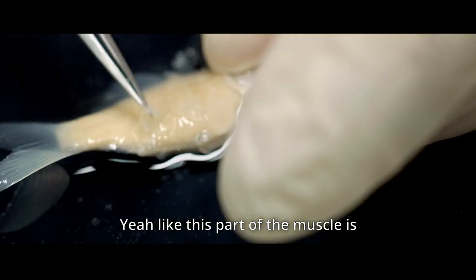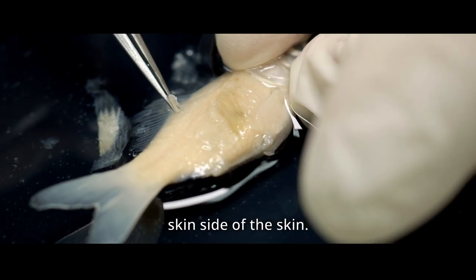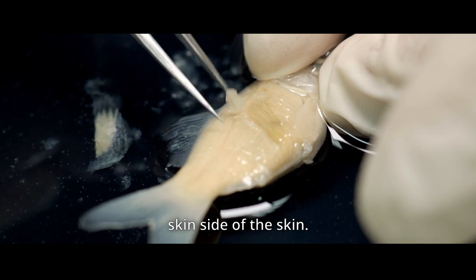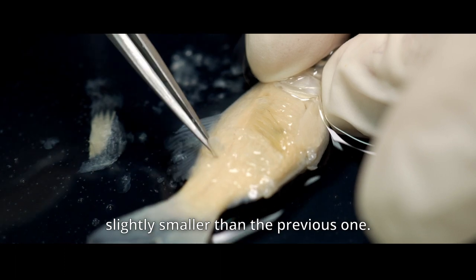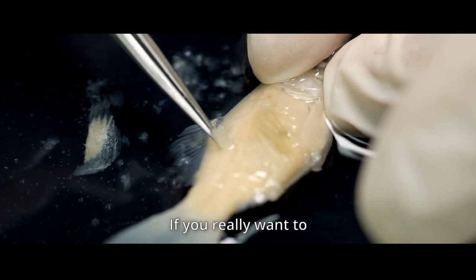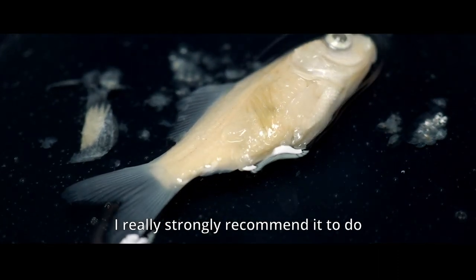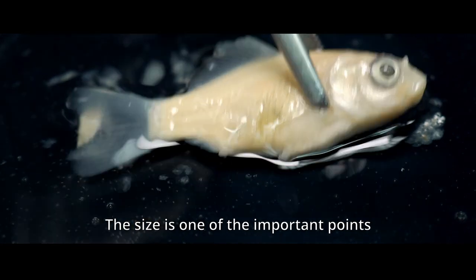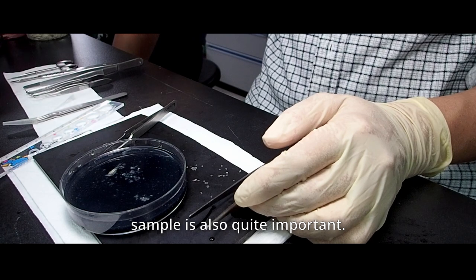Now, part of the muscle is really attached to the skin, side of the skin. And then, to do this, and the size is also, this one is slightly smaller than the previous one. Then, if you really want to do the accurate work, I really strongly recommend to do it under the stereo microscope. But the size is one of the important points, but the freshness of the sample is quite important.